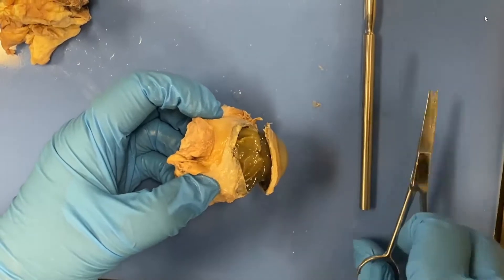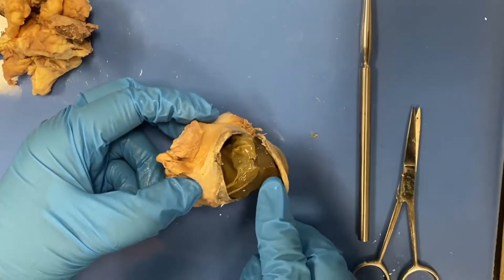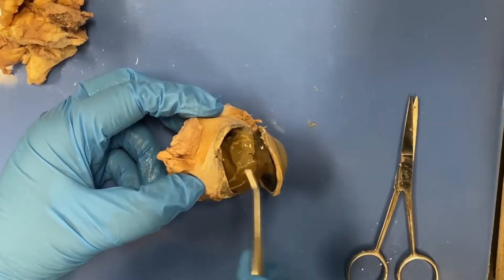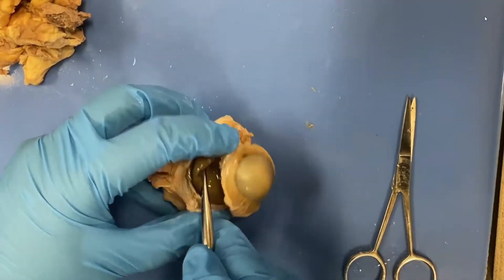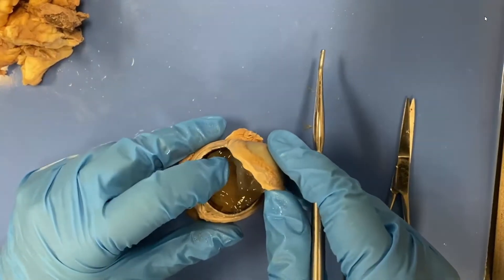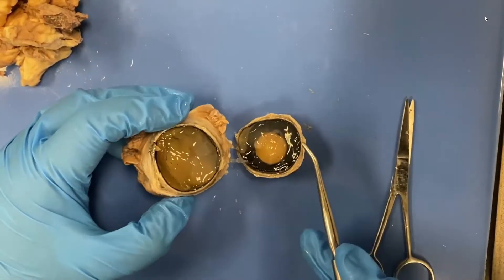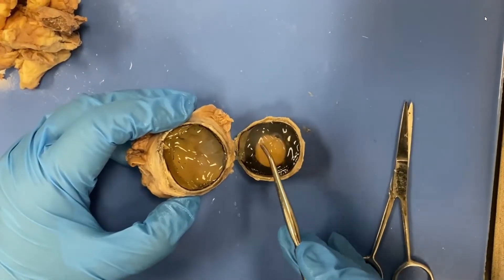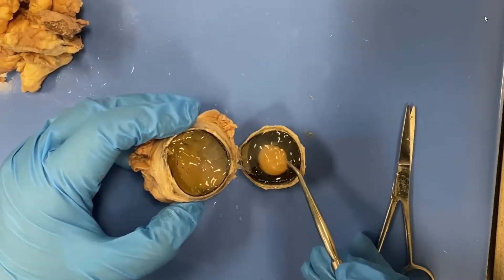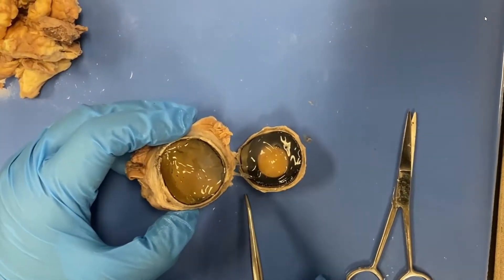We're going to split this out. You're going to see some jelly coming out. We're getting a little bit of the retina too — I don't want that yet, so I'm going to pull that back and pull this out forward. So you can see we're behind the lens. Again, this should be crystal clear, and it's not — so I'll let you think again: why is it not crystal clear?